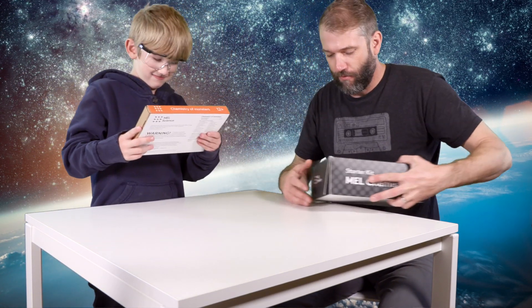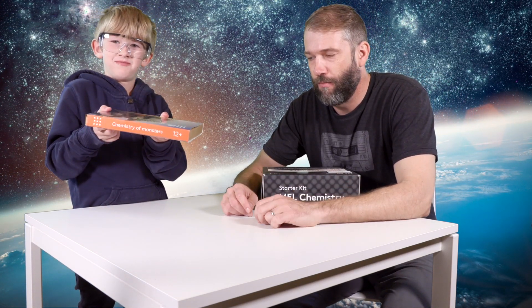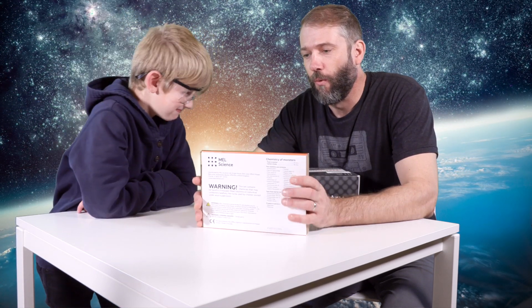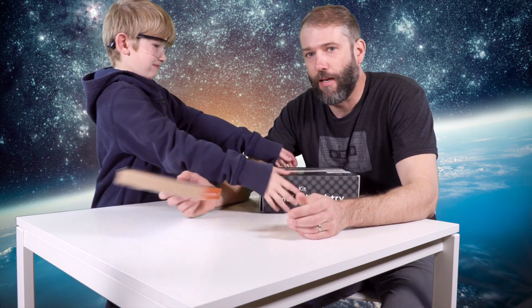What are we going to do today? First of all, we have the Chemistry of Monsters kit. There's a warning and then three more warnings on the back. Lots of warnings — should be insane. That's why we are here in outer space, well away from anything that might get damaged.